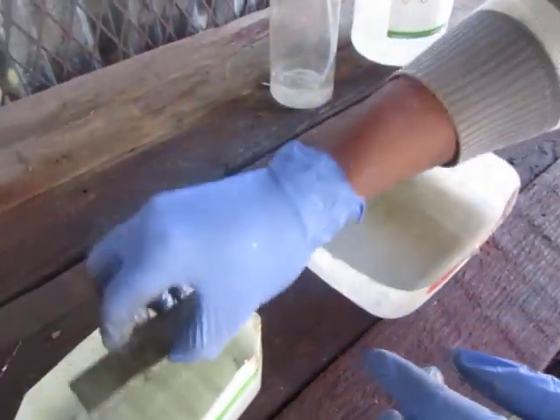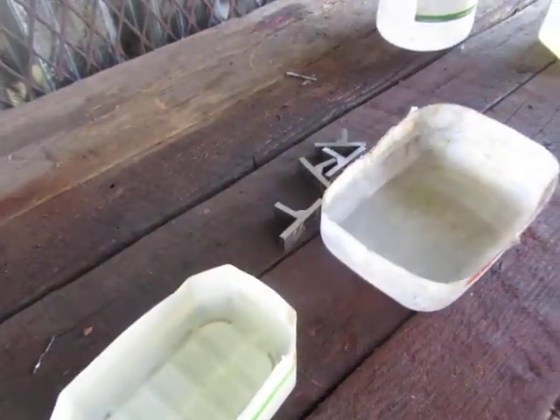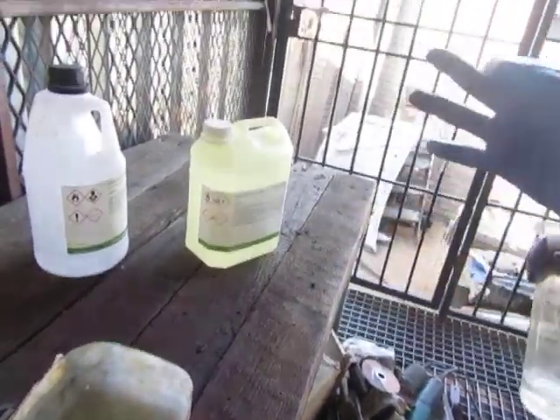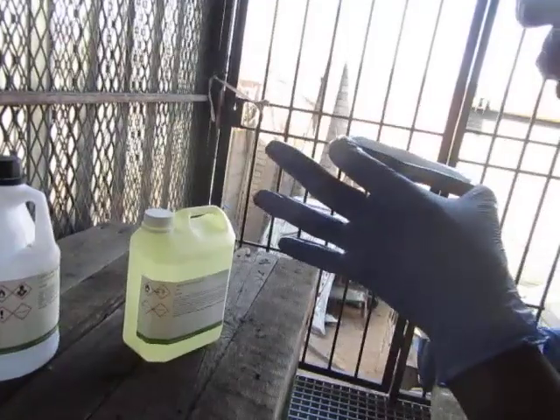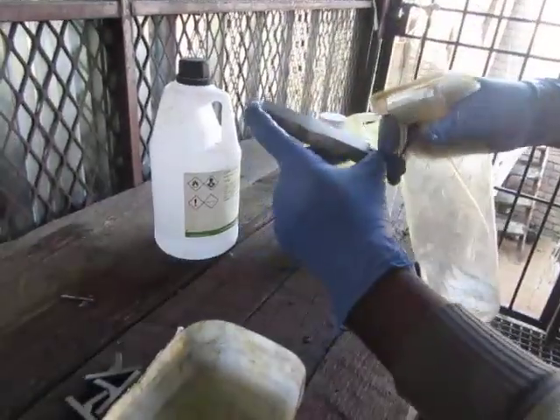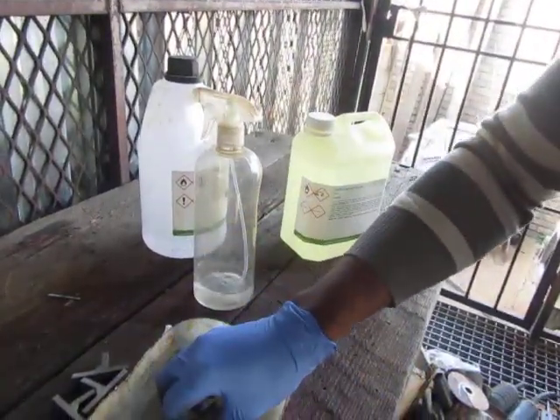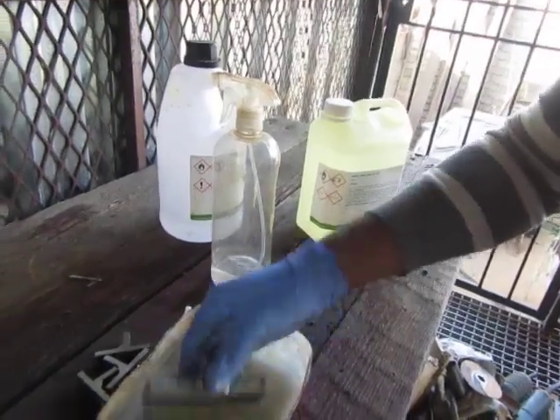The water here is just to rinse it. Then I'm going to spray alcohol — the reason why I'm using alcohol is just to avoid rusting of the sample here.